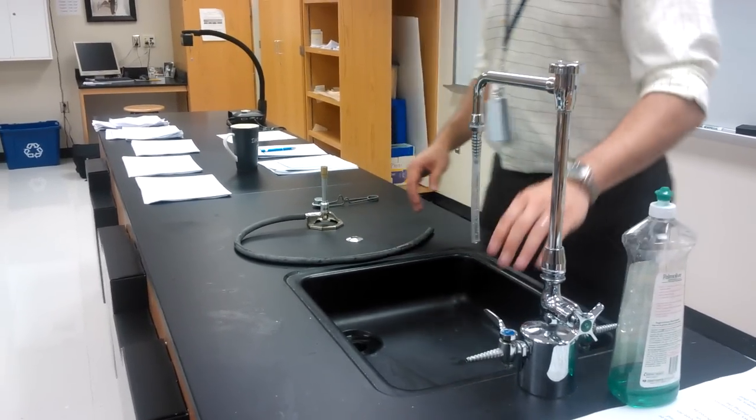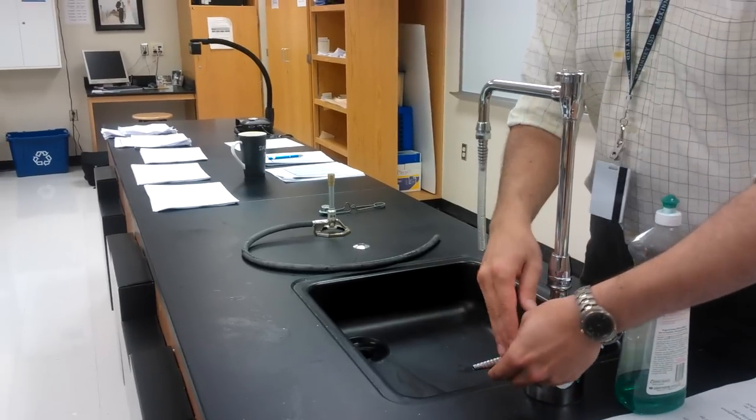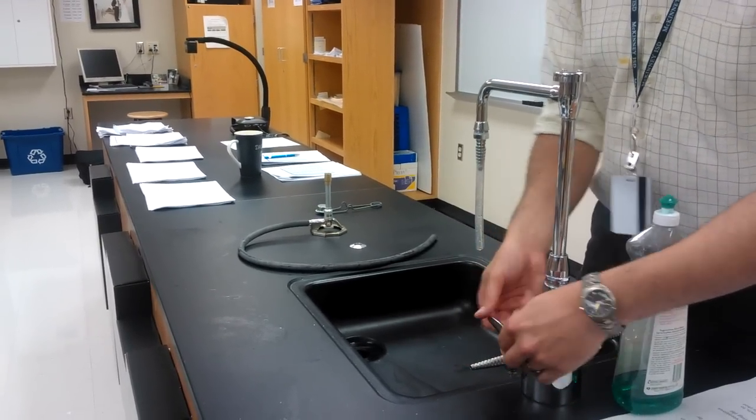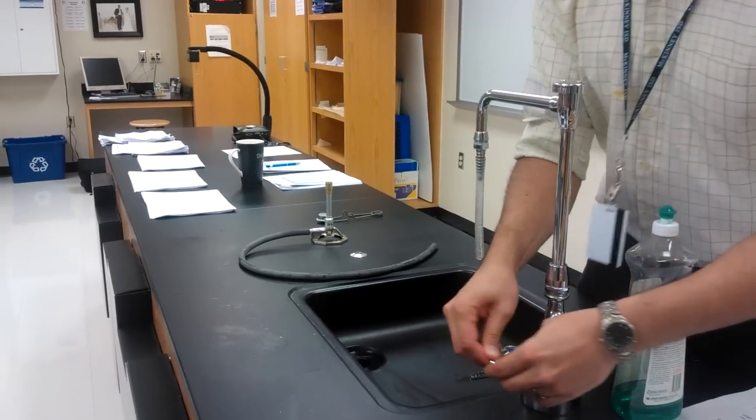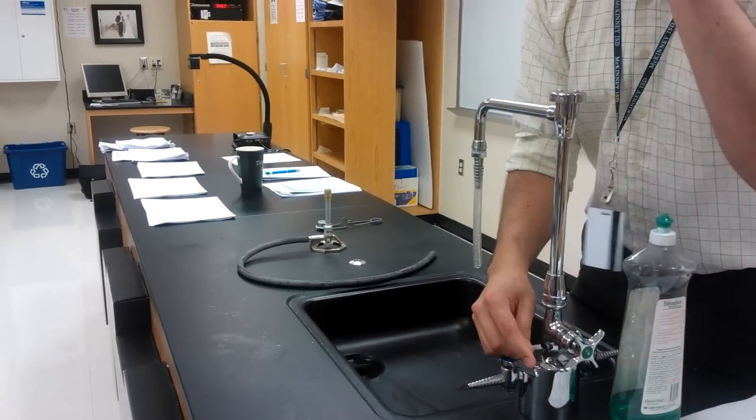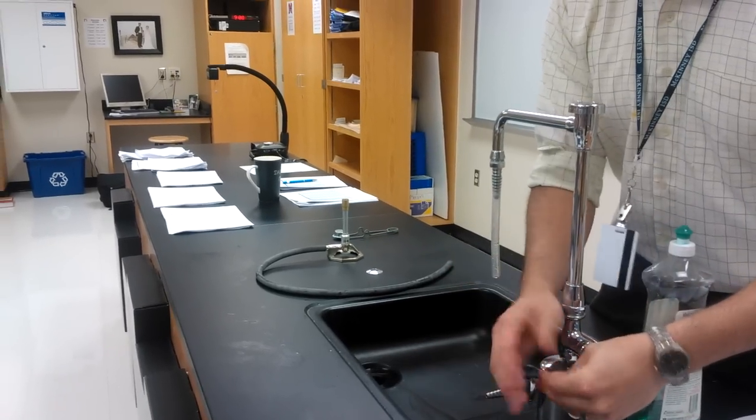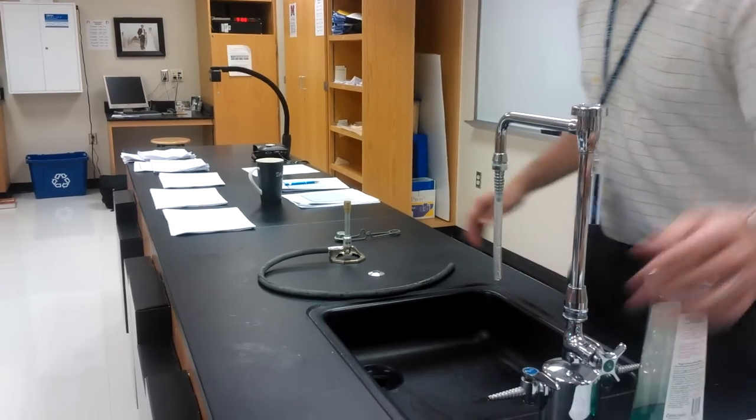We're going to be working with gas. Right now, the gas line is off. I know the gas line is off because it is perpendicular to the nozzle. If I flip it the other way, notice I don't hear the gas coming out. It's closed. As long as it's perpendicular, it's closed. If it's parallel, it's going to be open. I'm going to leave it closed for now.